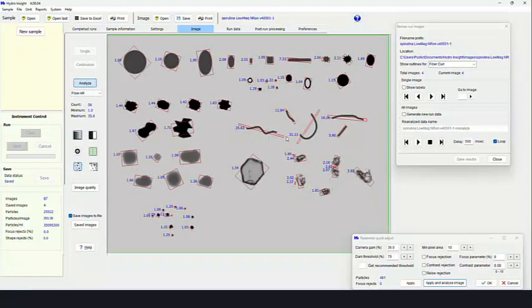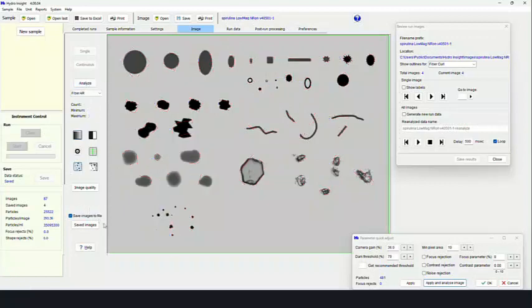So some of these fibers, as you can see, have a very, very high aspect ratio. Again, these are the measures that are very useful when it comes to measuring fibers to be a little bit more accurate and more practical, I guess is the better word. Another image that we're going to show you is actually a very interesting particle. It's somewhat curved. It's a particle that is called spirulina.